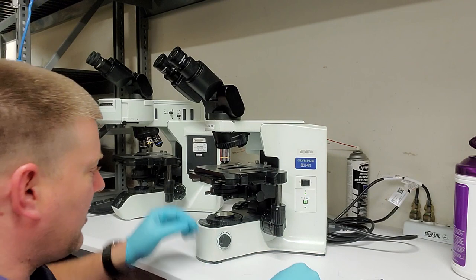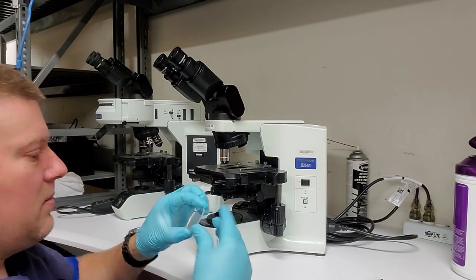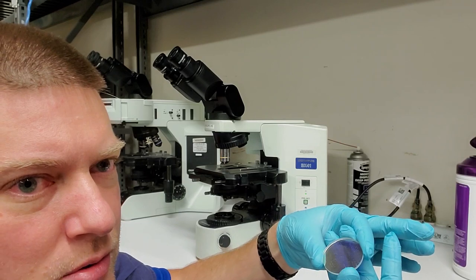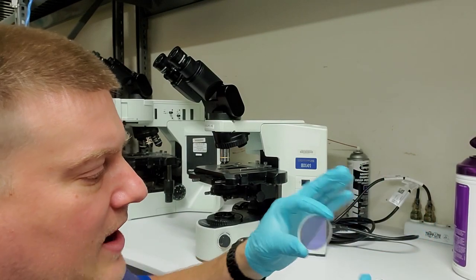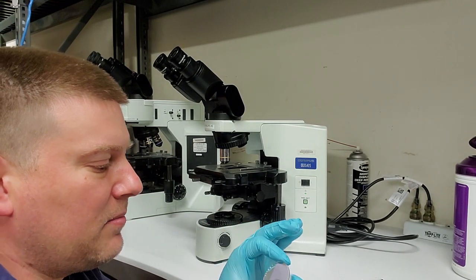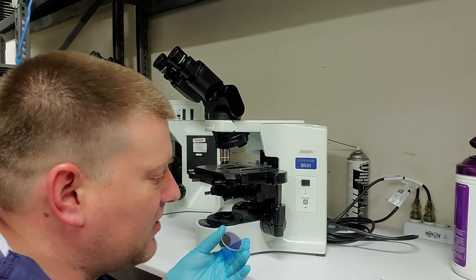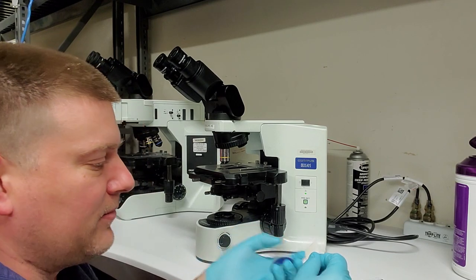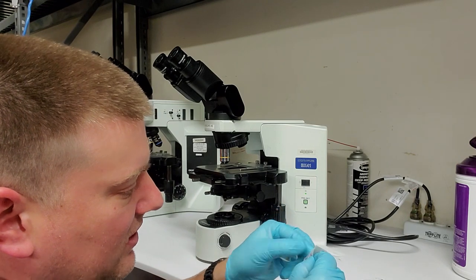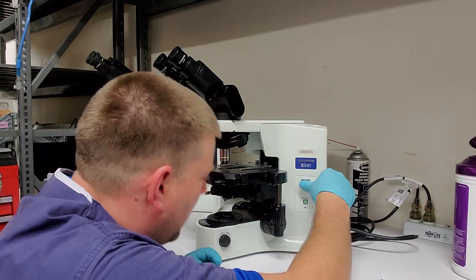I'm going to go ahead and crack it open. Here's my filter glass. I'm going to remove it. Now you can probably see there in the video that there's a little purplish hue. You see that? That is because it's set for a very particular wavelength to block a very particular wavelength. It says LBD IF. I don't really know what it stands for, but it matters to somebody. Alright, I'm going to take this guy here. And let's go ahead and turn him on.